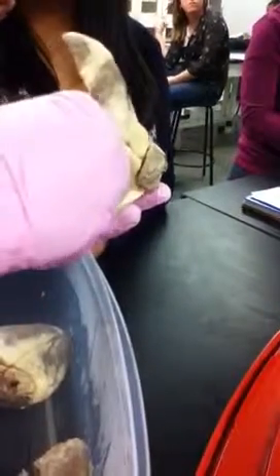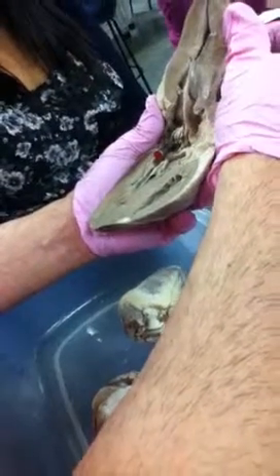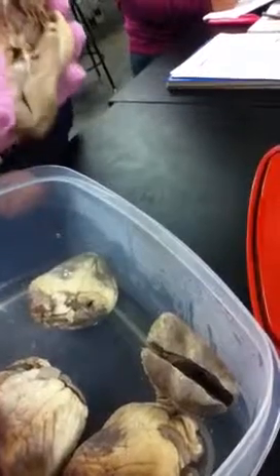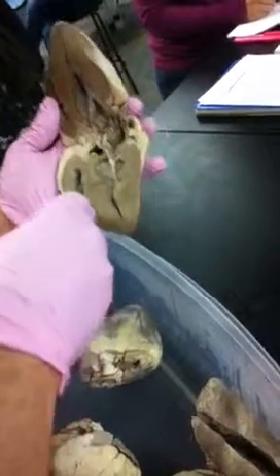So there's a probe in here, and it asks which vessel the probe is inserted into. It's going to be the pulmonary veins, right? Because it's the left atrium. Oxygenated blood goes into the left atrium. If it's going into the right atrium, and I'd have to show you a clear right atrium, let's just say up here, right atrium, what's going into the right atrium? The vena cava.